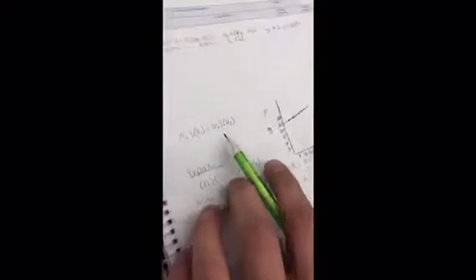With the equation for dilution, we're going to be using C1 times V1 equals C2 times V2. Now with the solutions we were given today, we used a 20% concentration times V1 equals a given percentage, which we can choose. We chose 3, being 5, 10, and 15, times 25 milliliters.